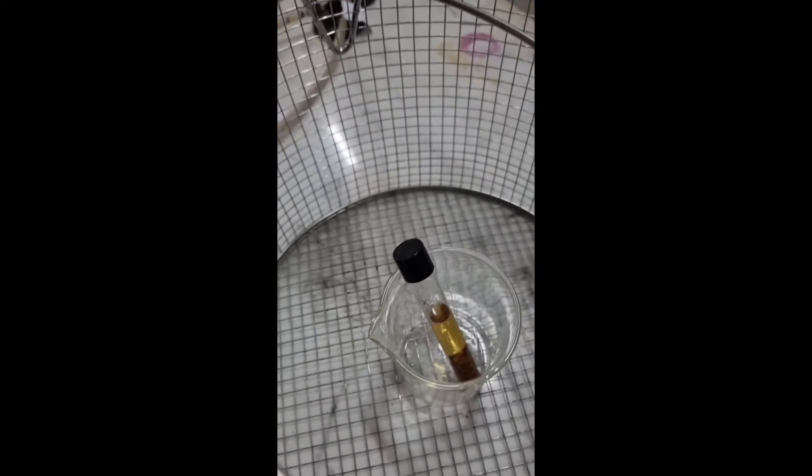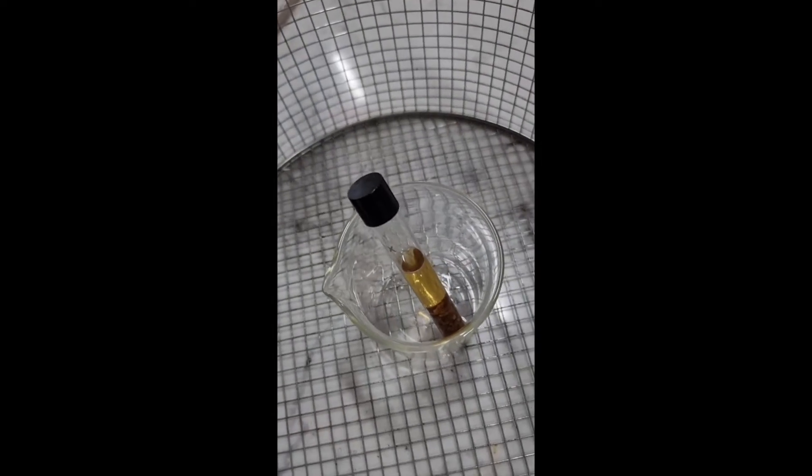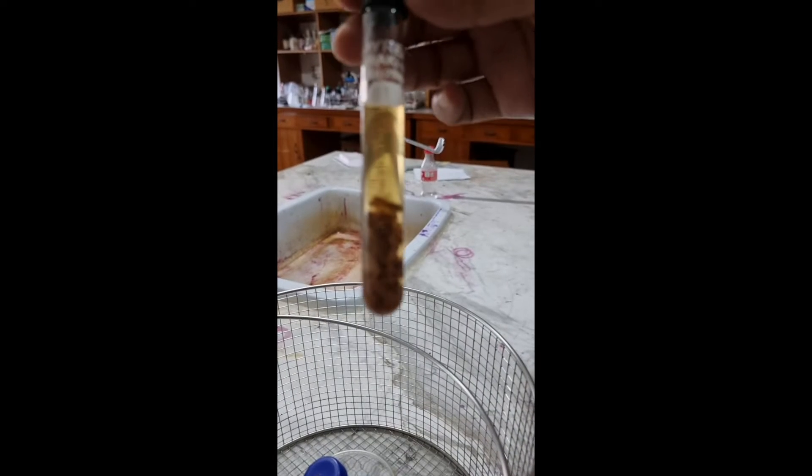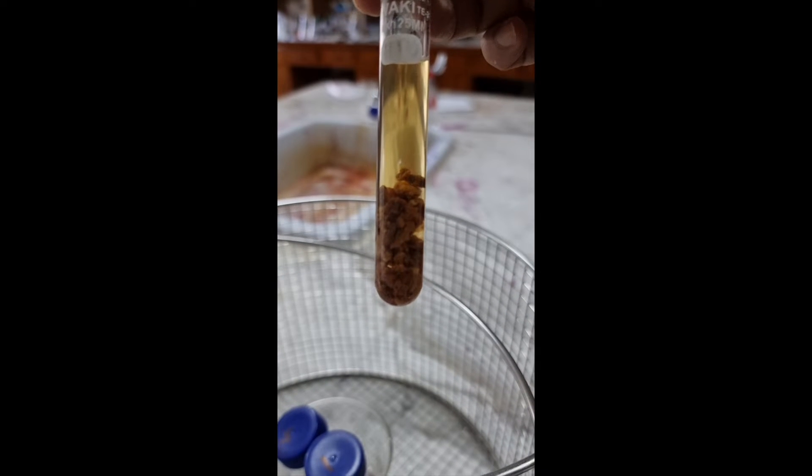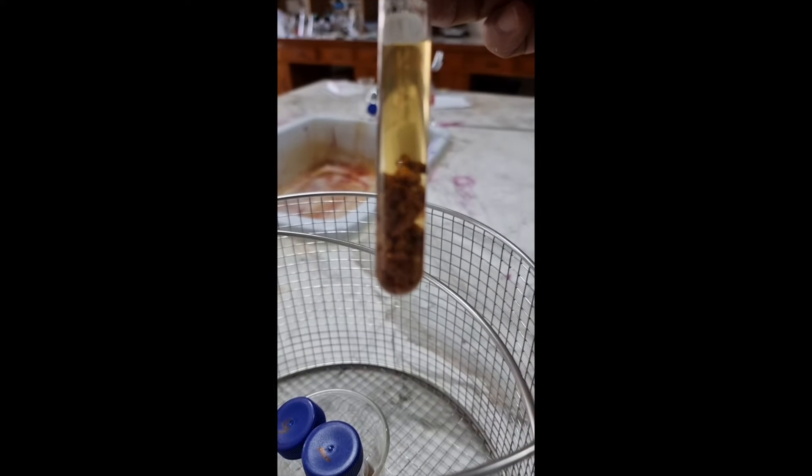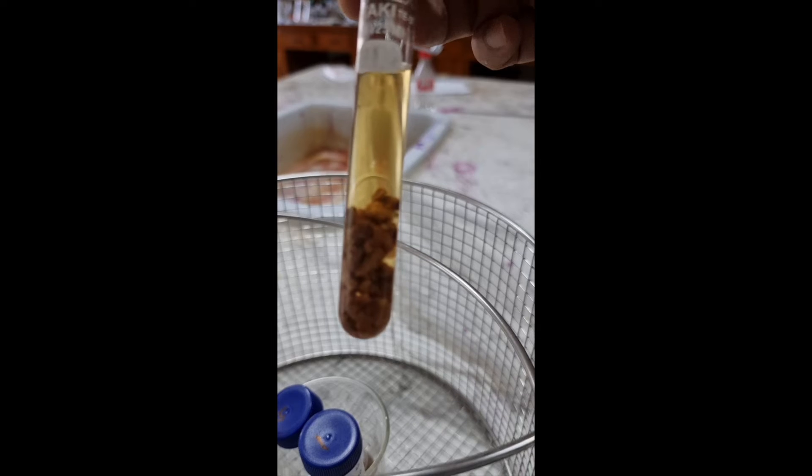After 15 minutes of autoclaving, the media is ready to use. This media is very reliable to culture anaerobic bacteria like Clostridium and it also acts as a maintenance media.